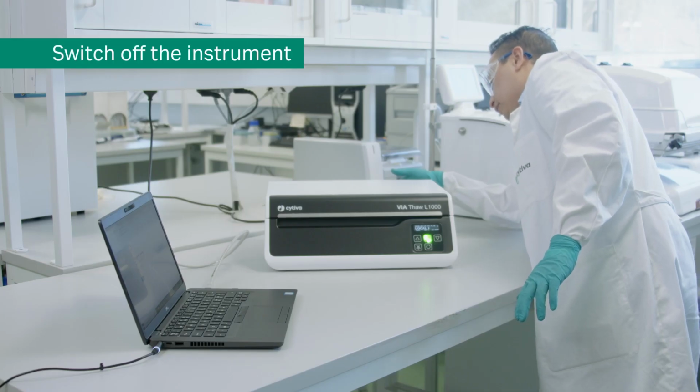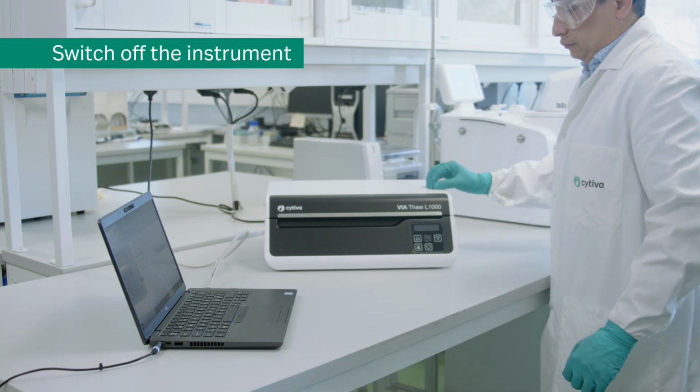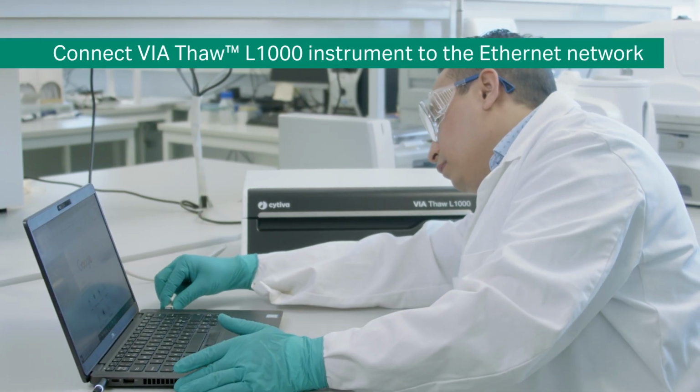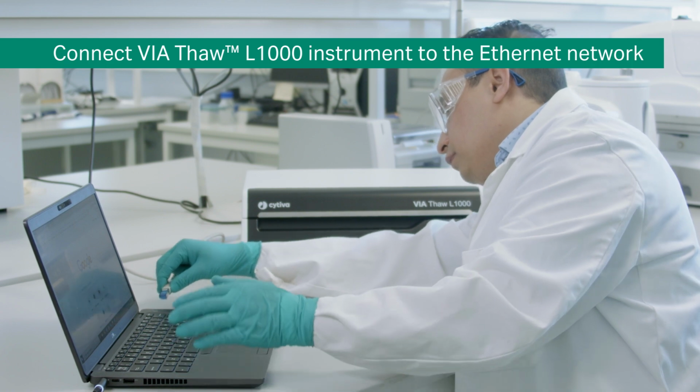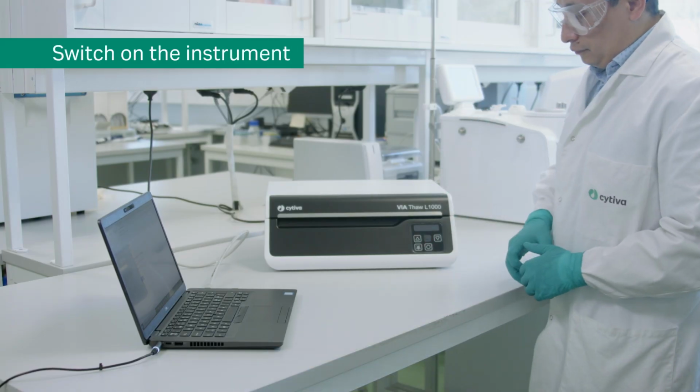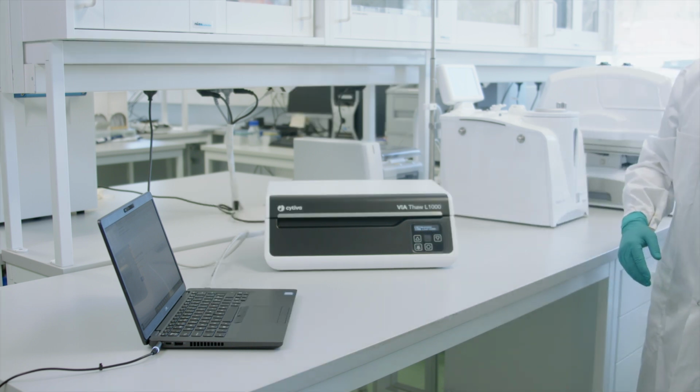Switch off the Thaw L1000 instrument using the power switch. Unplug the Ethernet cable from the laptop and connect the Thaw L1000 instrument to a compliant network terminal. Switch on the Thaw L1000 instrument. The network icon appears on the thawing profile screen.